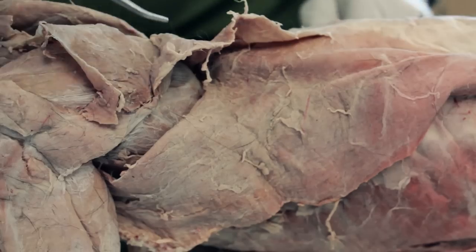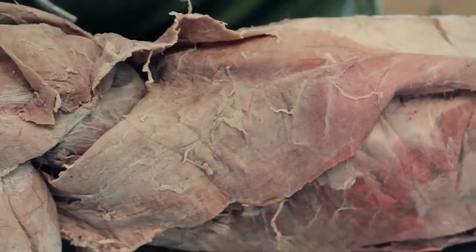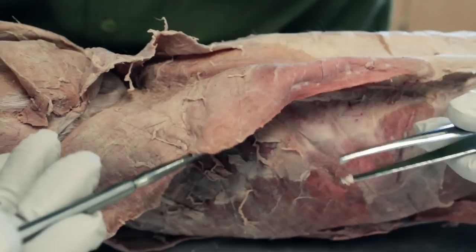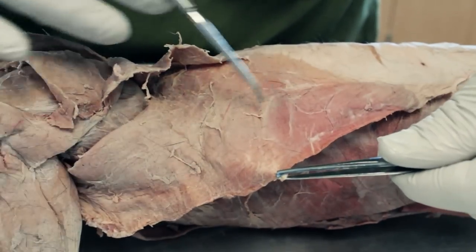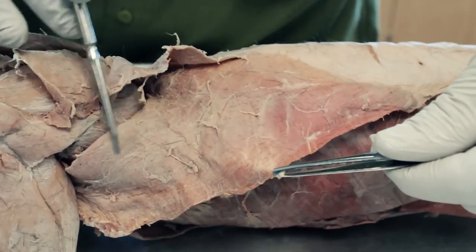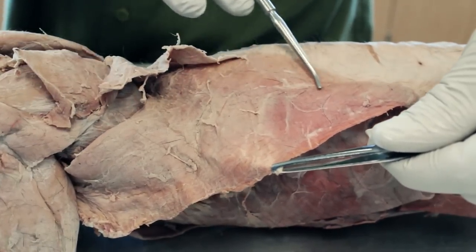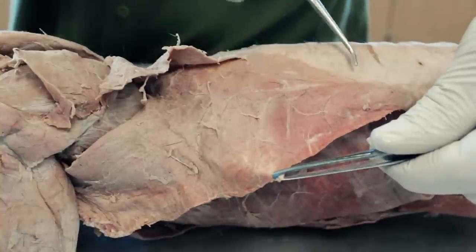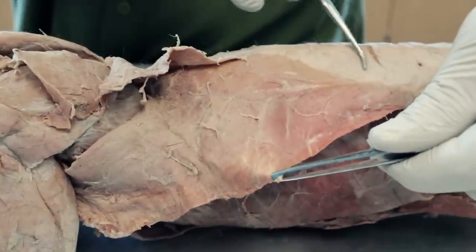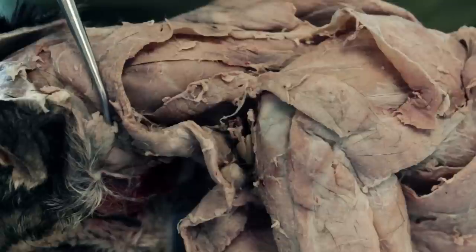The latissimus dorsi is kind of like a trapezius muscle — it's the biggest, most prominent muscle on the side of the cat, and we can see it in this whole area here. Remember, the latissimus dorsi is attached to the lumbodorsal fascia, which is in the posterior part of the spine.